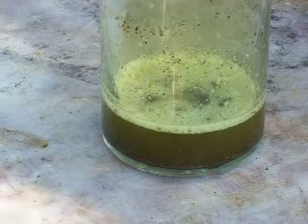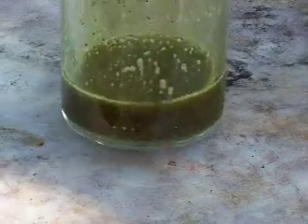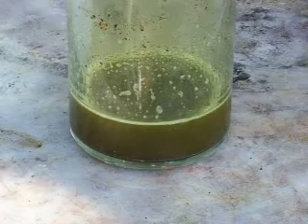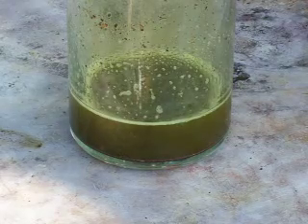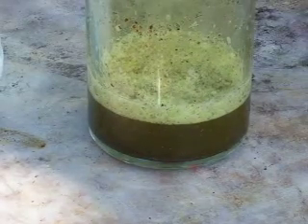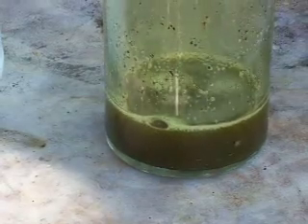Add a little bleach, let the reaction stop — still have some foils. Normally I would give it several minutes before adding more; it's just wasteful to keep pouring in bleach. But for the sake of expediency in the video I'm going to add a little more. The smell of chlorine is very strong because it's actually chlorine gas being emitted, and that's what dissolves the gold — the chlorine gas. It may be hard to see for all the trash, but the foils are being dissolved.